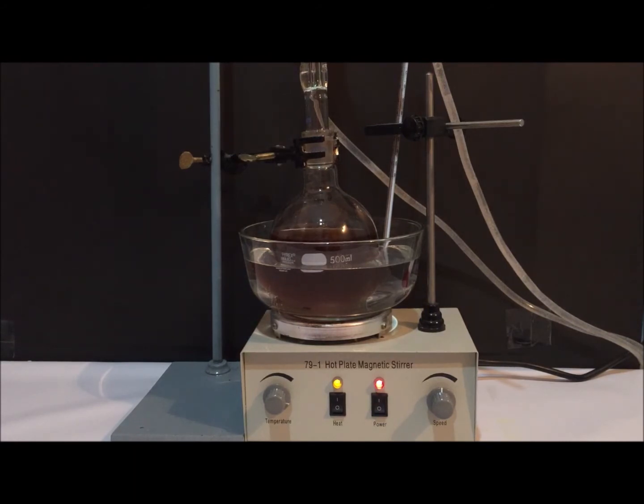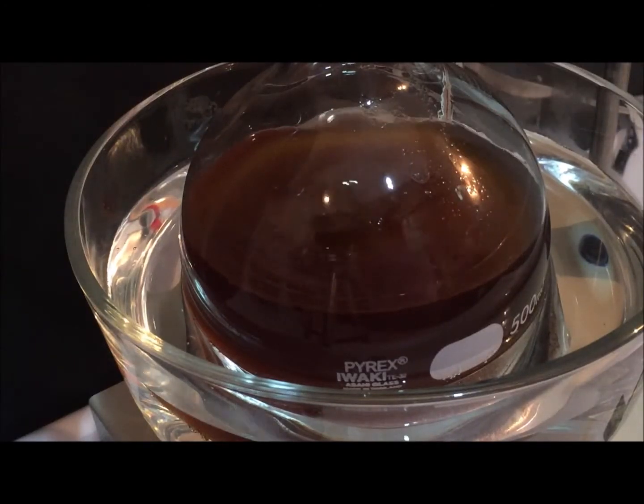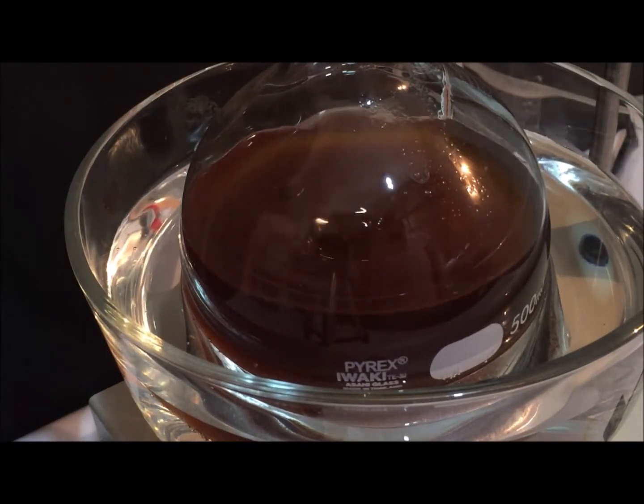The reaction is dependent not only on the amount of methanol and catalyst but also on the temperature, the rate of stirring, and water content. The presence of water causes a yield loss due to the formation of soap. It should be made sure beforehand that there is very little moisture in any of the reactants. Strong stirring is required because methanol is immiscible in oil and without stirring would simply form a layer on top.